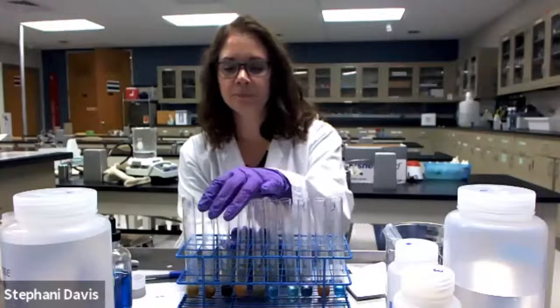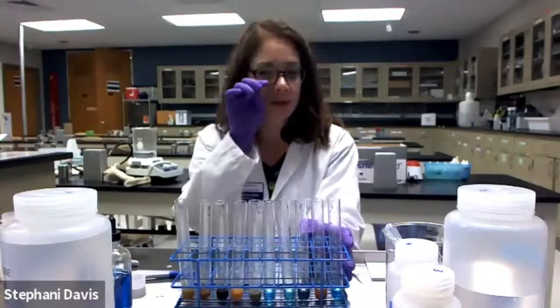Okay, so that's it for the Benedict solution test. I'll go ahead and take pictures of those and post them. And you can expect to see questions for you to interpret these results and test your understanding of macromolecules.